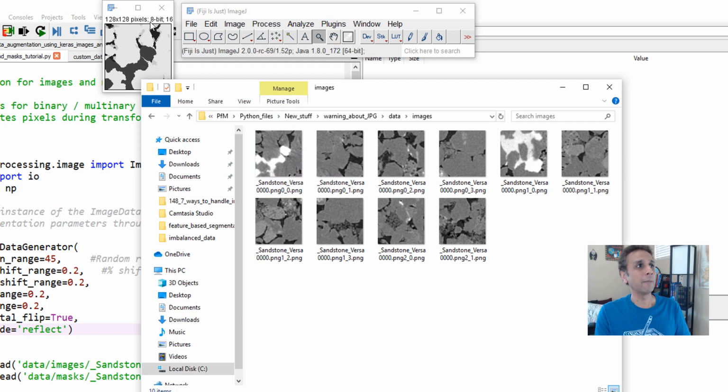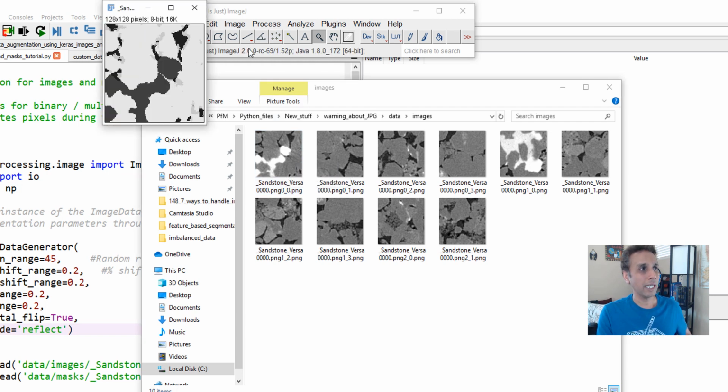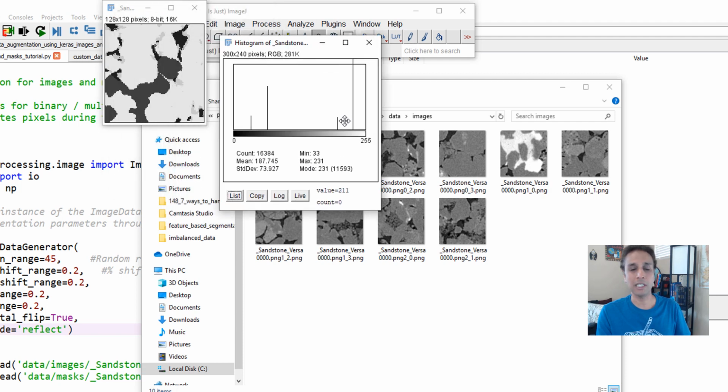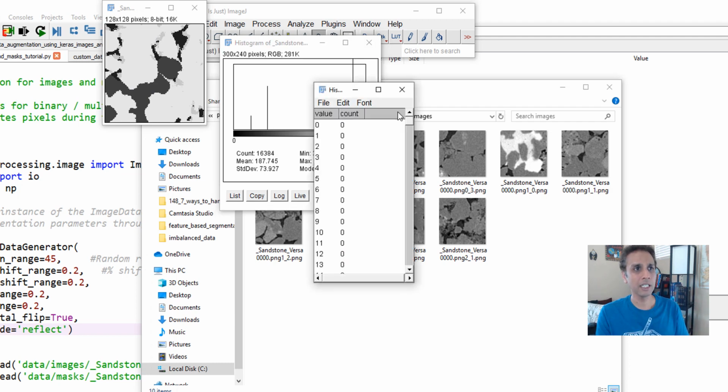So now, if you go back to my image and look at the pixel values, let's bring up the histogram. You can see the histogram has four peaks. That means all the pixels in my image are represented by four values. That's it. If you look at the list, these values are 33. I have 957 individual data points showing a value of 33. And then I have 65 and 201 and 231. At 201, there are 862 of these data points, and 231 right there.